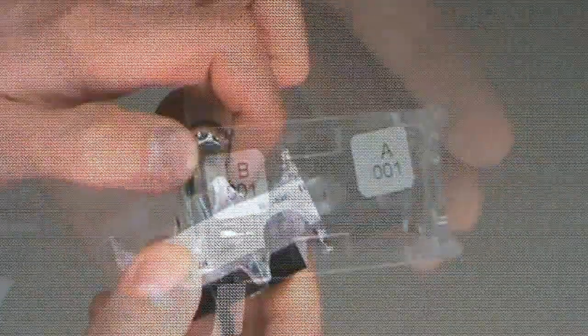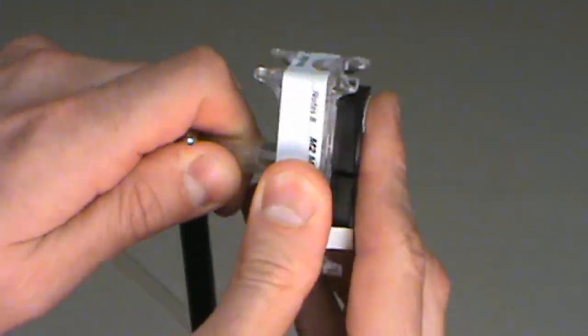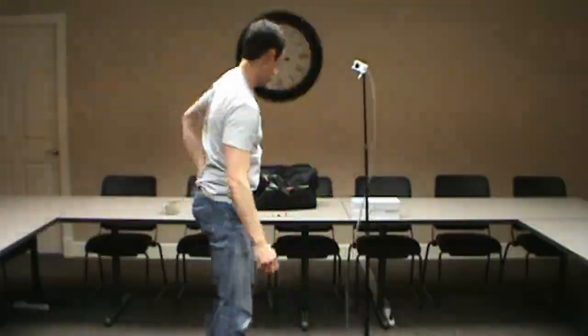Connect the mold cartridge to the end of the hose. Be vigilant in making sure the number and location on your chain of custody match the number and location where you're collecting the sample.